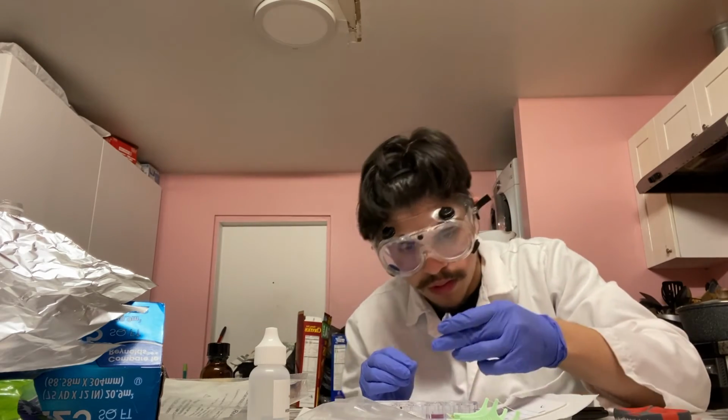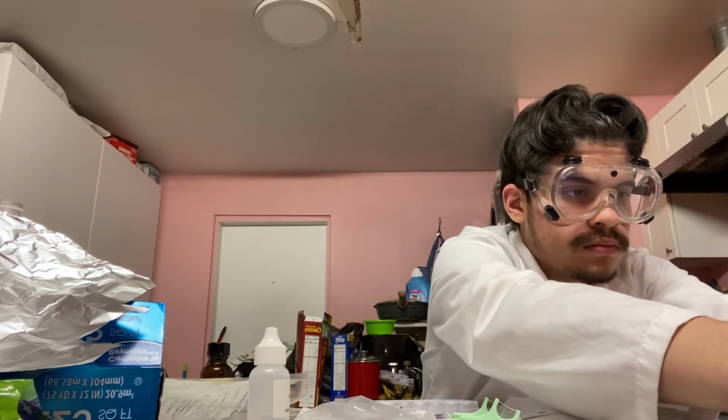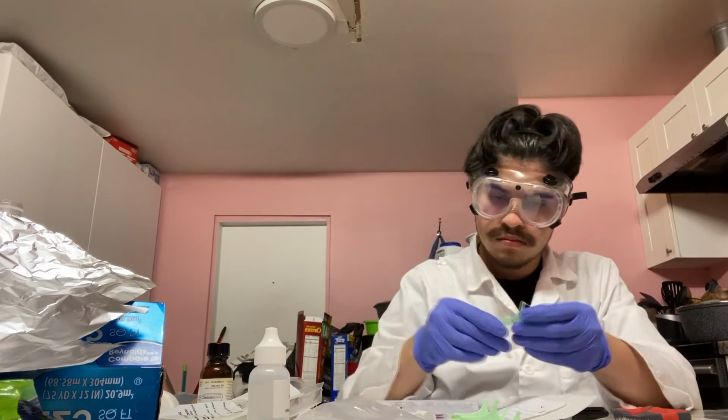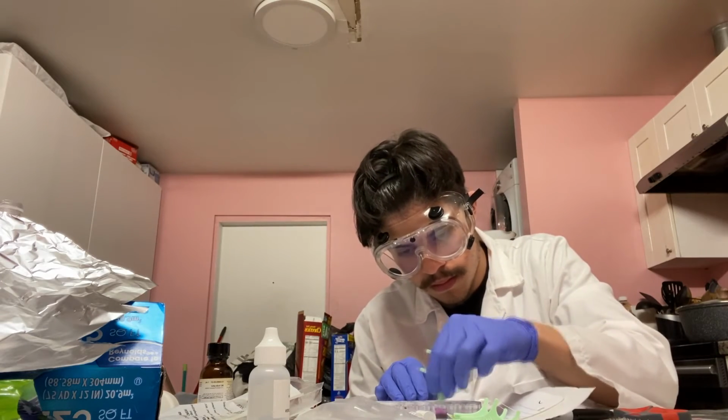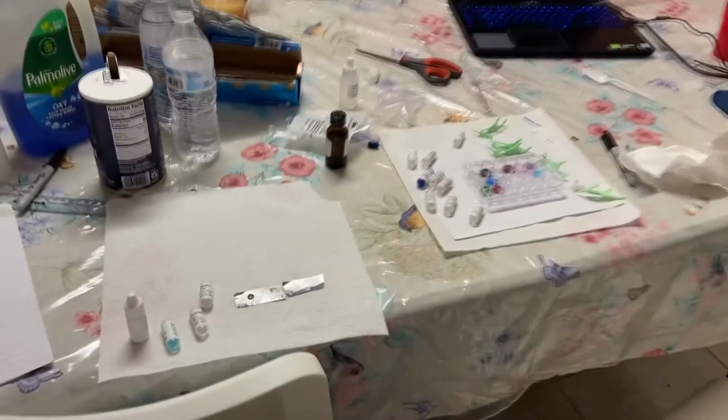Once the 2 compounds have been poured in to cause the chemical reaction, make sure to use a toothpick to stir. 4 different things will be recorded in part 2 of this experiment. Considering that we are working with 2 different compounds for each chemical reaction, we will be recording each compound's initial state. Once the chemical reaction has occurred, we will be recording what we observe. And finally, we will be determining whether the chemical reaction was a chemical change. All of these components will be recorded for each chemical reaction. There is a total of 14 reactions that will be recorded in this part of the experiment. And that concludes the procedures.